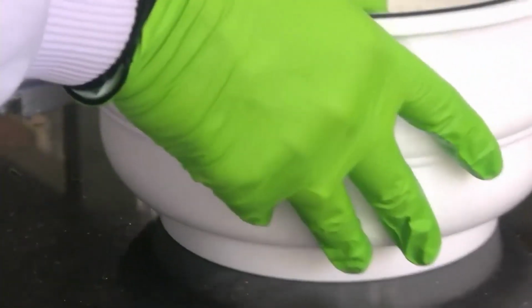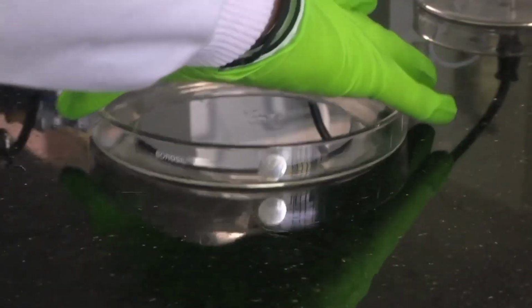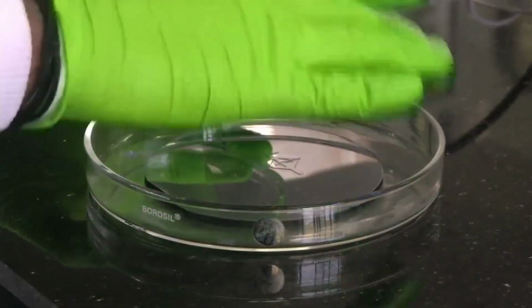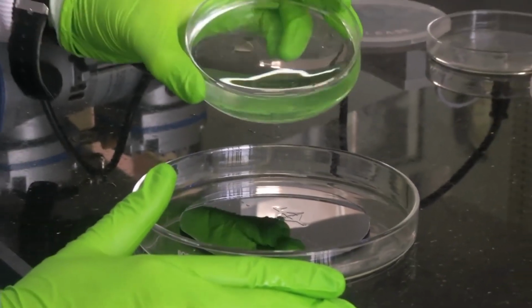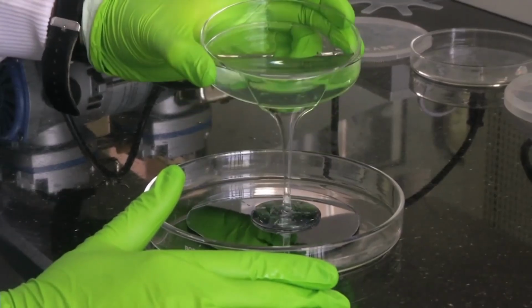Now this clear liquid we have to pour on top of our mold. So we have the mold here. We have put it in a petri dish. Now we have to pour our PDMS curing agent mix on top of the mold. Try to focus there.